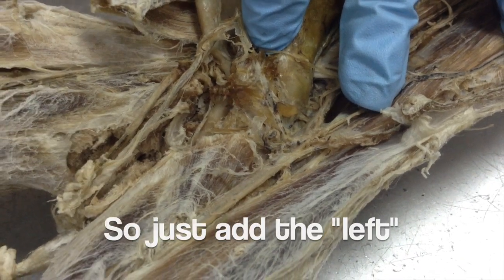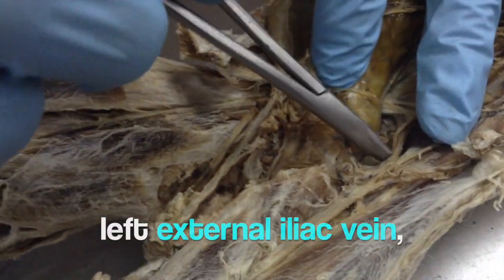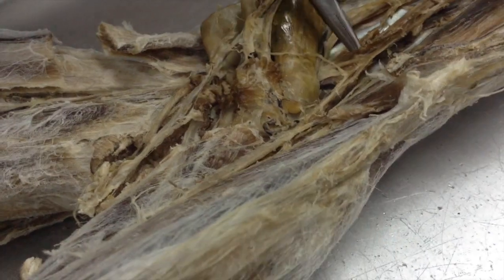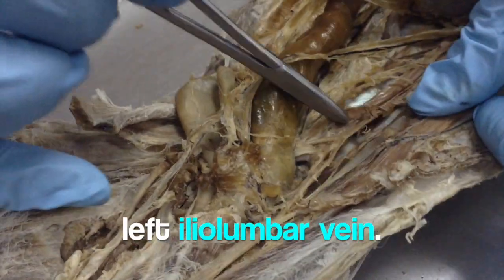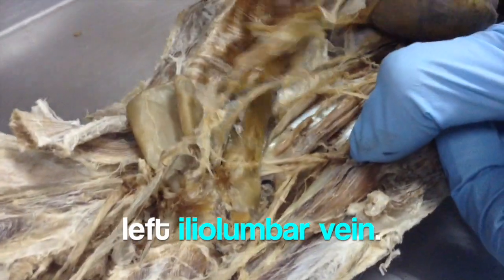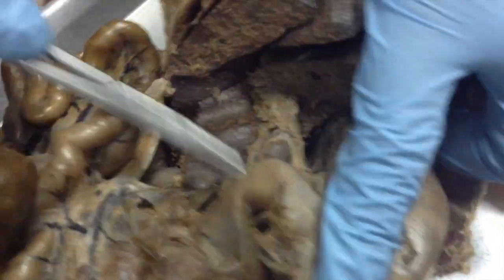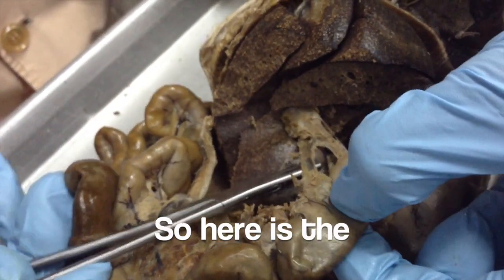Here is the femoral vein. So on the left side of the body: the left femoral vein, left external iliac vein, left internal iliac vein, left common iliac vein, and left ilio-lumbar vein.